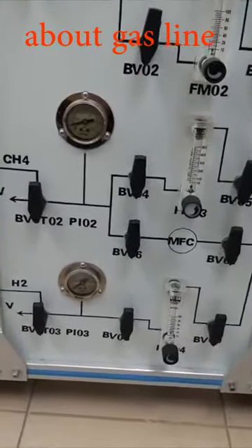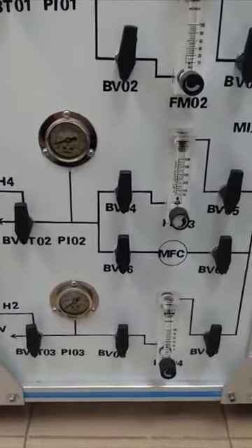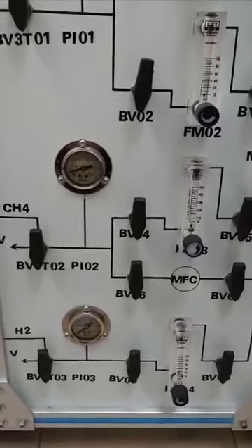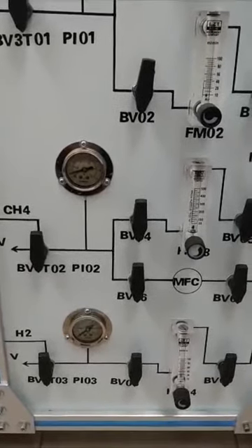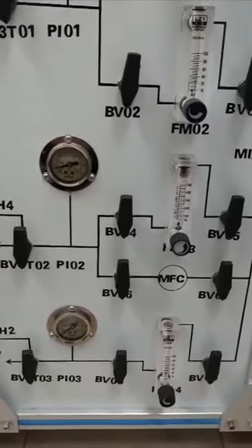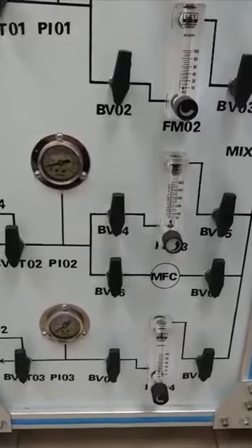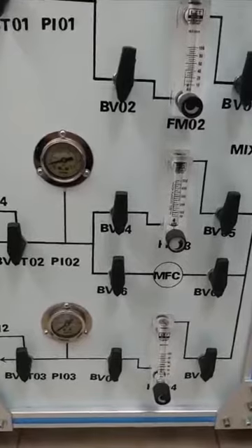The function of the hydrogen we use in this design is for the reduction of your catalyst. So whether you use the hydrogen or not is dependent on your experimental design, whether you will use hydrogen to reduce your catalyst into a reduction form or oxidation form. But I think here it will be a little bit difficult for you to do a reduction, because commonly the reduction of the catalyst needs a little bit high temperature, right? But in this system, we don't have high temperature being supplied.